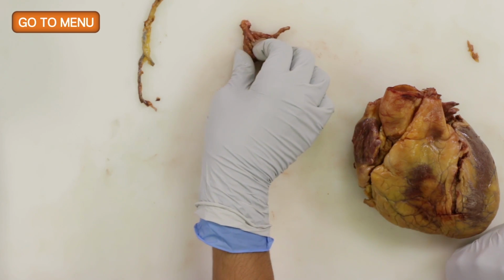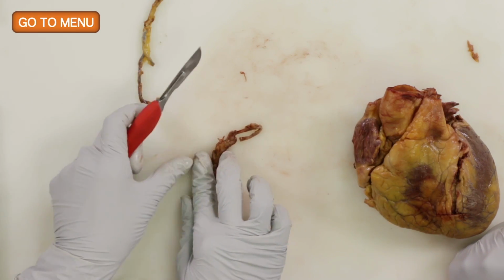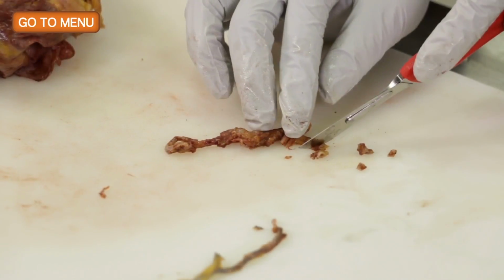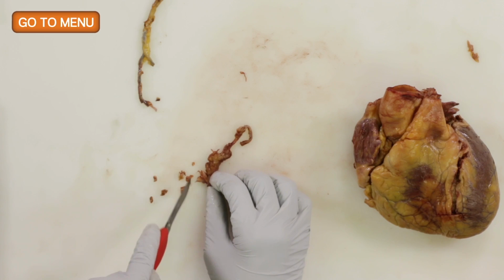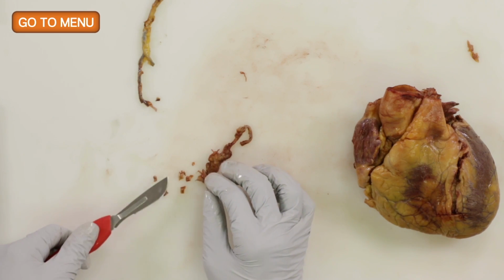So why don't you go ahead and do that now? Okay. At the same time, you want to see how much stenosis is present. We're still not submitting it for histology, so there's a chance, as long as you can cut through it, then we can put it in the decalcifying solution and then submit it for histology after that.